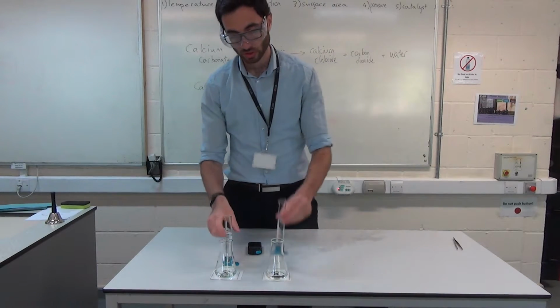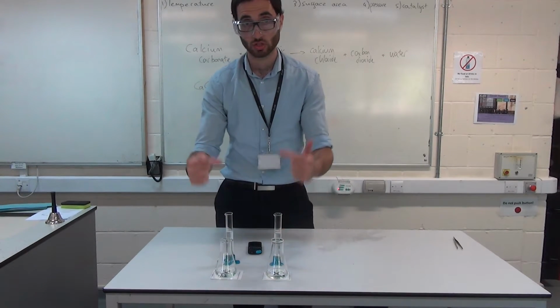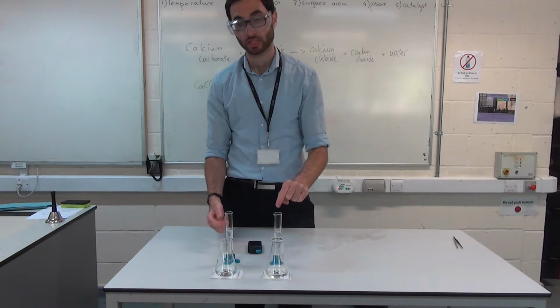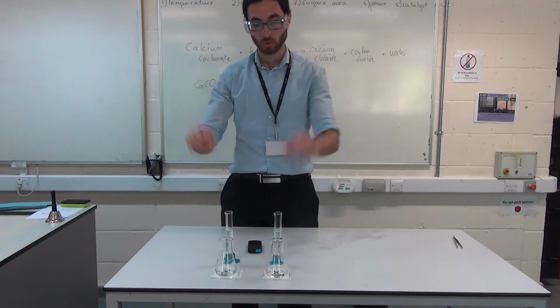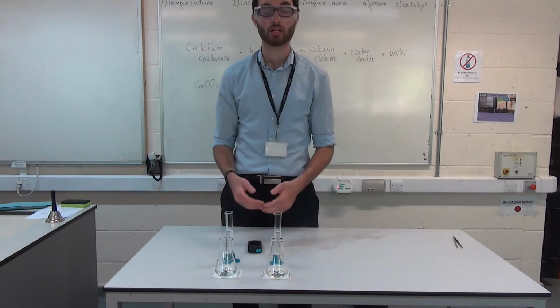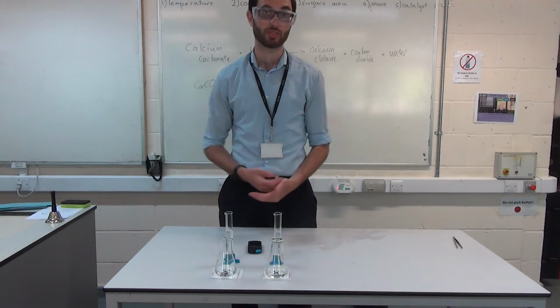I've got two different concentrations of sodium thiosulfate, which is what I'm going to be reacting with my acid. Acid in here, sodium thiosulfate there. This one is very concentrated, and this one is much less concentrated. This one's about 10 times as concentrated as that one. What I'm going to do is I'm going to pour them both in at the same time. I'm going to hit my stopwatch, and I'm going to see which one clouds over first. And then I'm going to hit the stopwatch for that, I'll lap it, and then I'll do the stopwatch for the other one as well, and I'll get two different times.